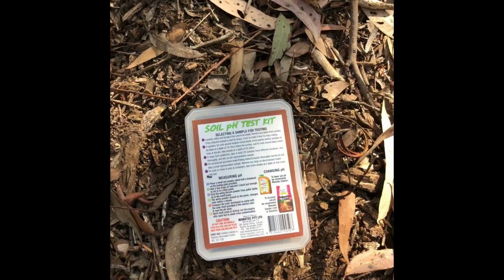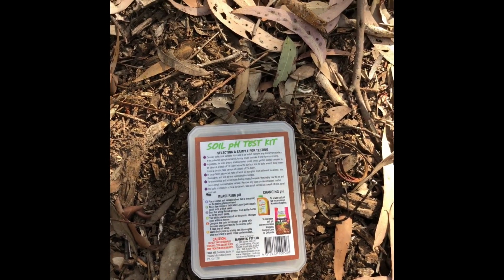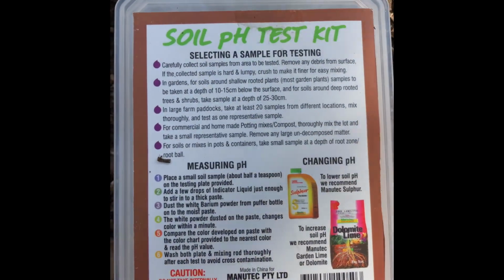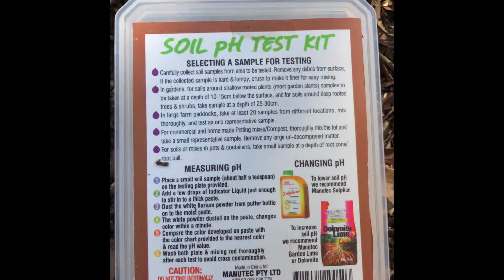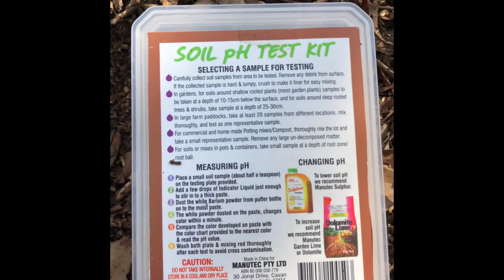which is a chemical test. Now to do this, it's a really easy thing to do. The instructions are on the front, so you've just got to follow those stepwise instructions, and you'll find that it is not a hard test to complete in the field. So I'm going to show you how to use that right now. Now this process is fairly simple because all you need to do is follow the instructions on the back of the packet. It tells you everything that you need to do, and as long as you follow that, you cannot go wrong. So we're going to do that right now for you.